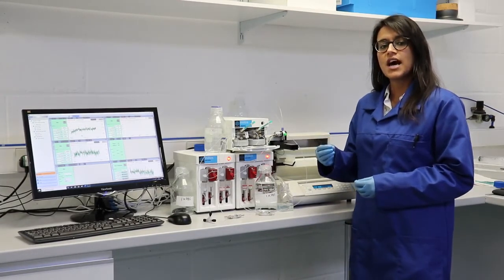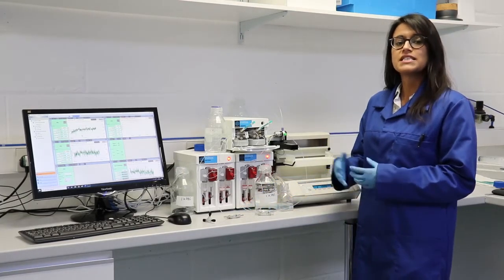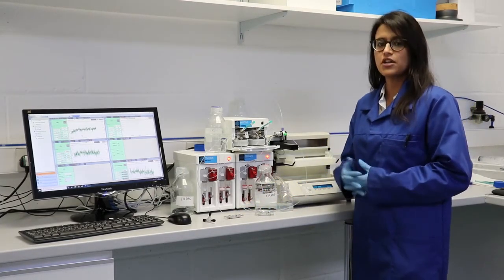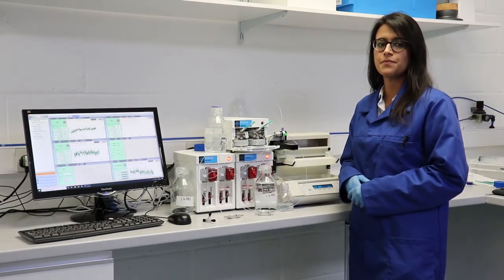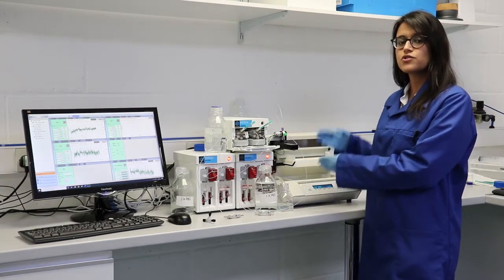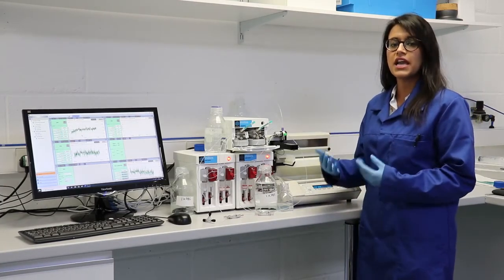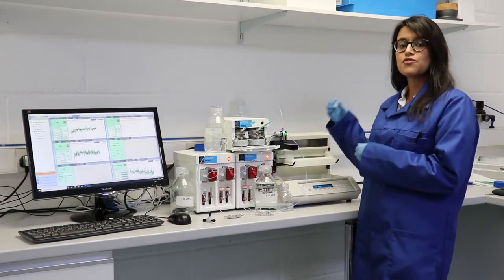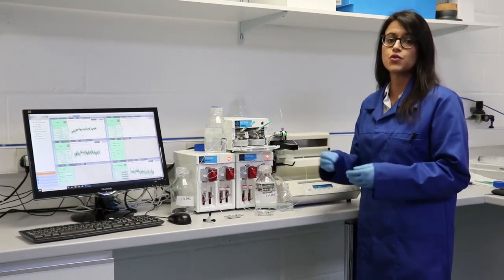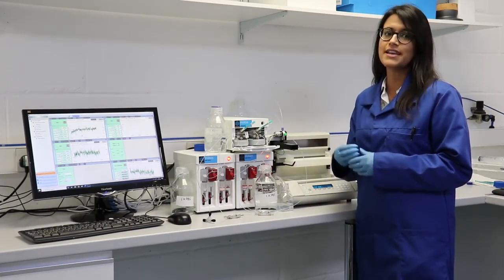Once the two fluids have converged in the first chip, downstream a T-junction chip allows a further dilution of your sample. This is optional and you may choose to skip this step. Your fluid packet then travels to the automated collector where the automated valve allows the collection of your sample in 1 ml vials. The type of rack can also be altered according to your desired collected sample volumes. This includes using a 96 well plate.